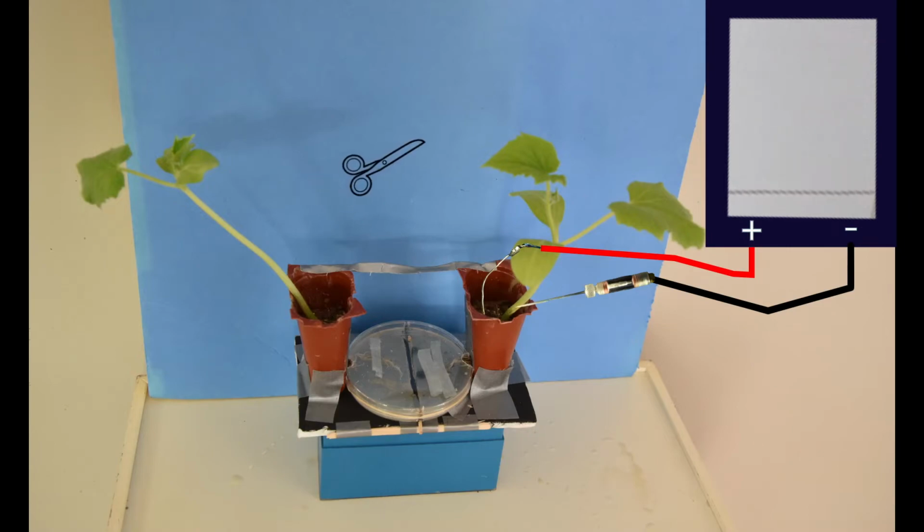After this final measurement, we perform one last test. We go back to the same plant we are measuring in and snip a leaf. If we see a large and rapid depolarization, this will help show us that our plant was effectively recording electric activity over the course of the experiment.